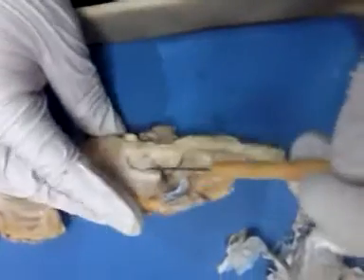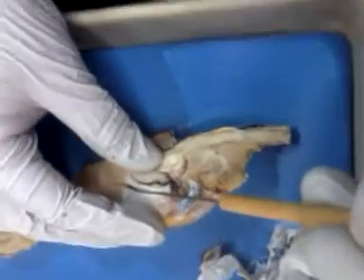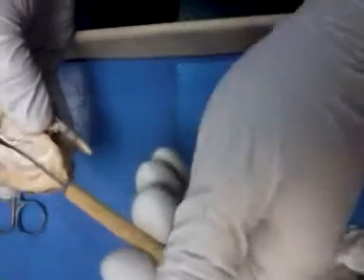Okay. Yours has got a very small, okay, this right here. When I pull it apart, okay, that's your lateral ventricle, and it has this membrane. Oh, I've just busted it. There's a membrane that you can kind of see. Let's see if you can see it on this side. Nope. There's a membrane that they'll have like a probe sticking sideways.